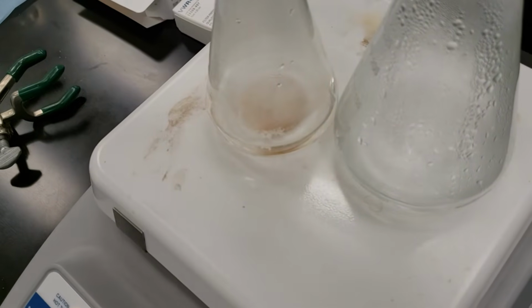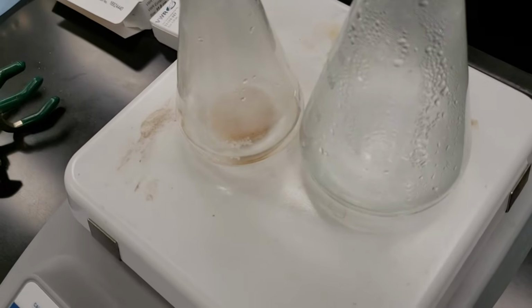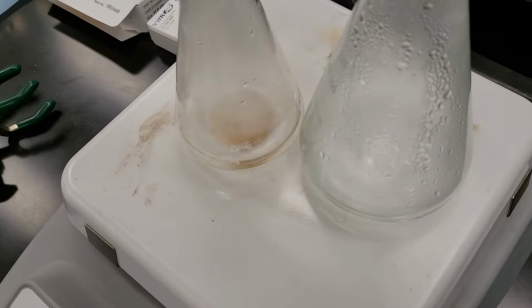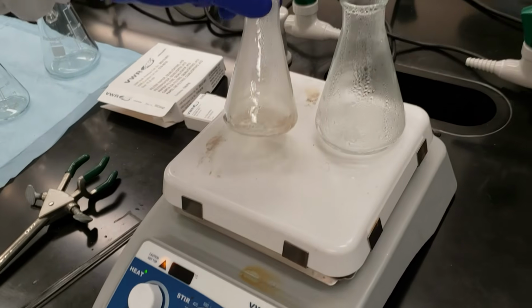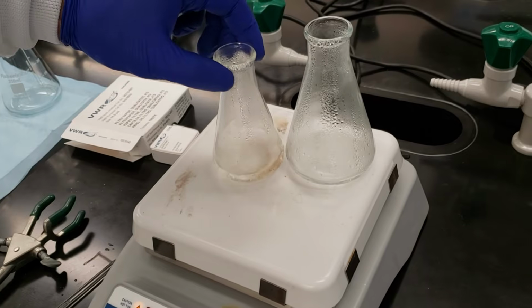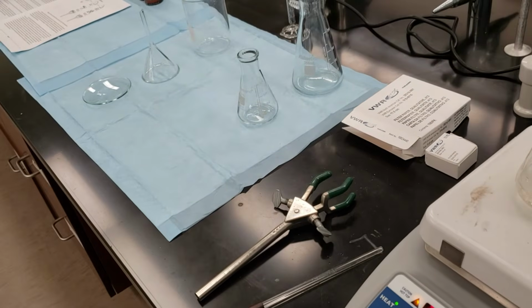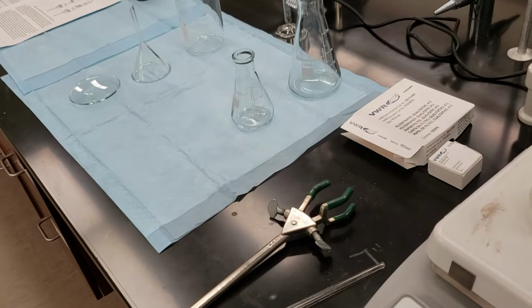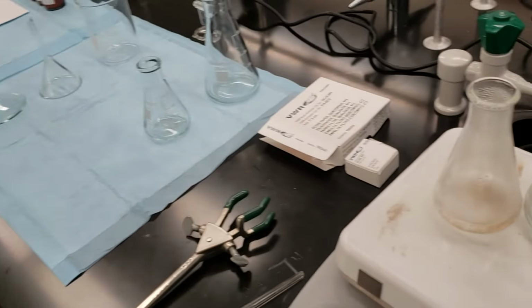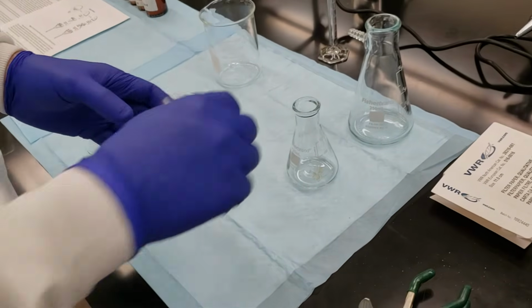I'm going to leave that to heat for just a minute to see if we can get the last of those crystals to dissolve, and then we'll check back in. So all of our compound is now dissolved into the water that we added to our flask here. We're going to let this heat on the hot plate for a few minutes while we set up our gravity filtration. Our pure compound is dissolved into our DI water. Our sand remains insoluble, so we're going to use a gravity filtration setup to separate the two.